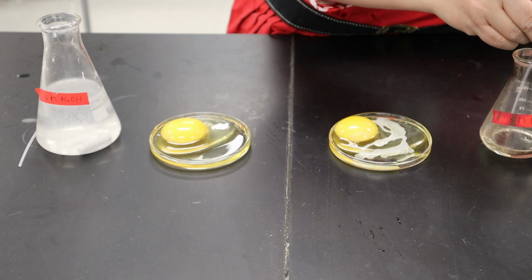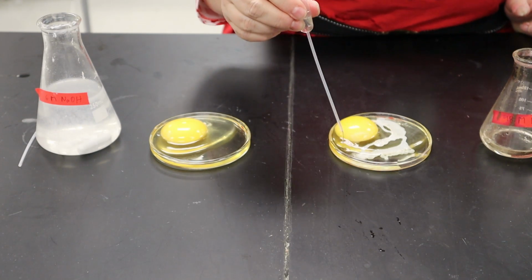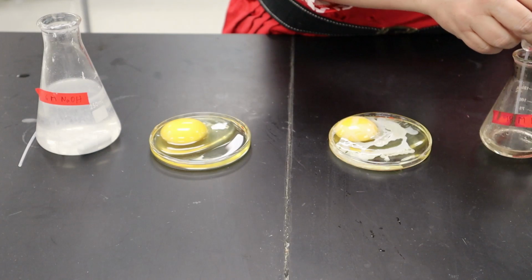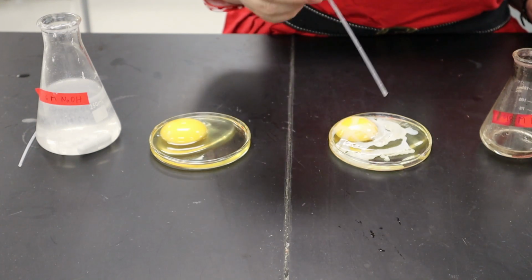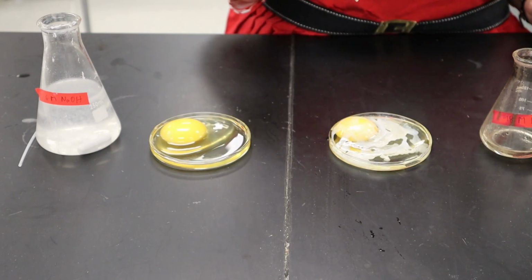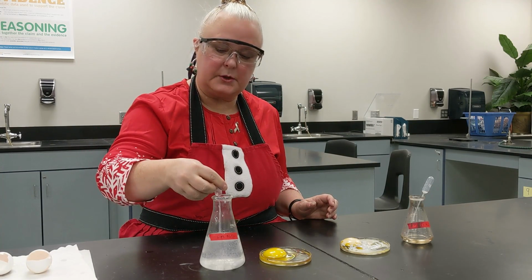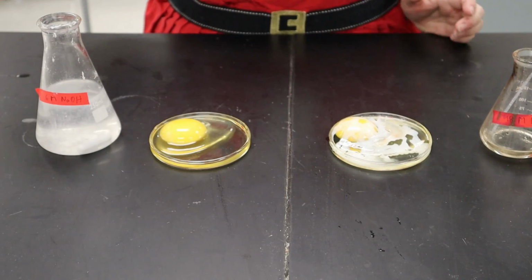So let's look at this again. You can see that this is turning white immediately. And let's try it with a base. This is sodium hydroxide. We would use this base in this class many times.